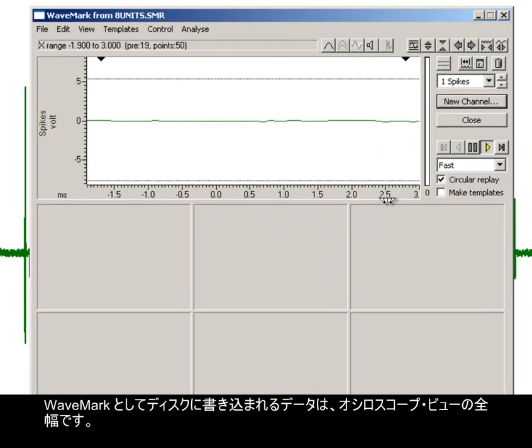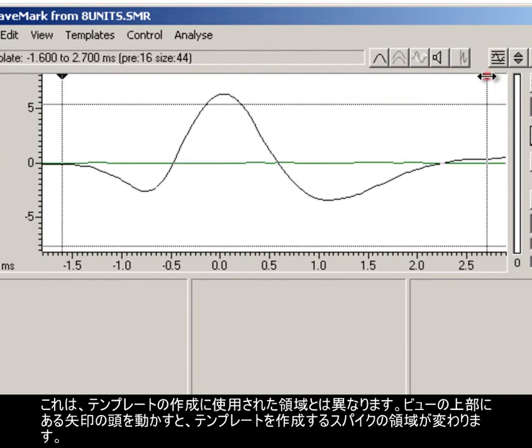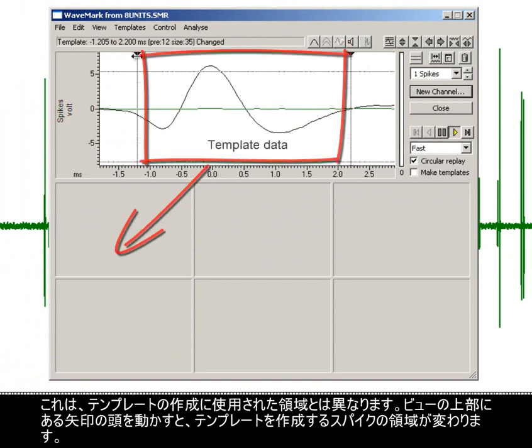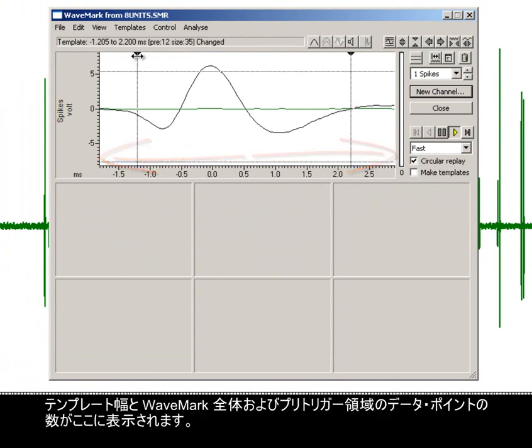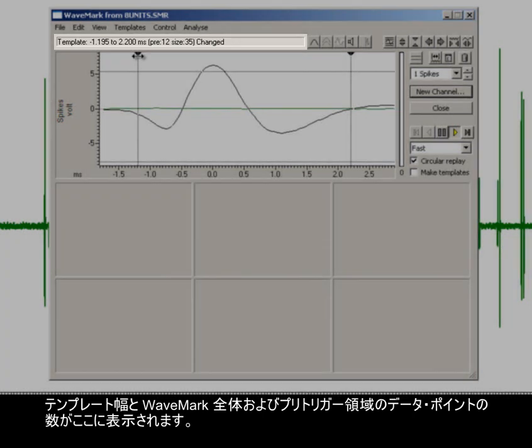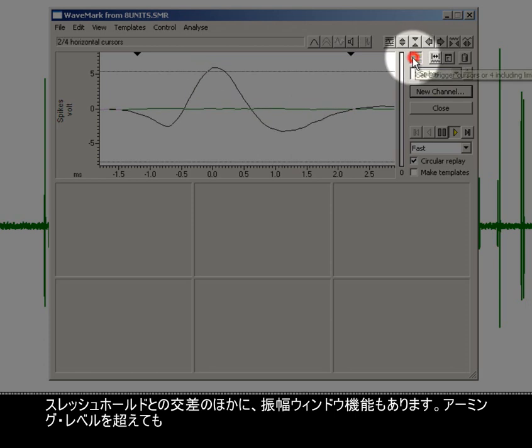The data written to disk as a WaveMark is the full width of the oscilloscope view. This is different from the area used for templating. Moving the arrowheads at the top of the view changes the area of the spike to template. A display of the template width and the number of data points for the whole WaveMark and pre-trigger area is shown here. In addition to threshold crossing, there is also an amplitude window function.